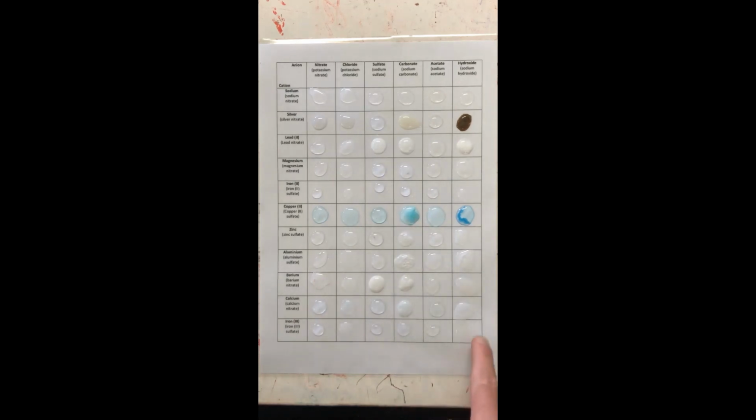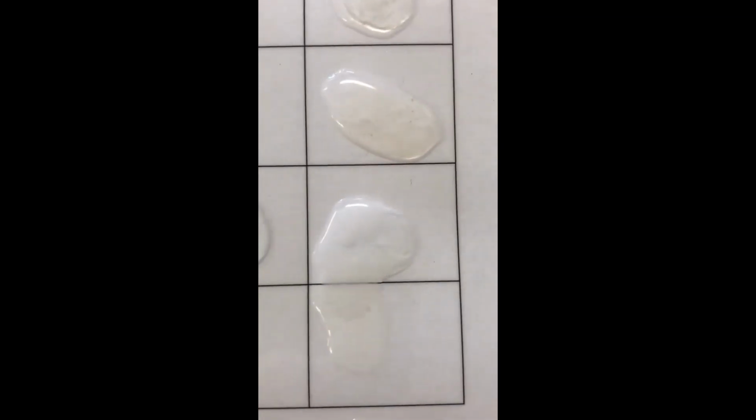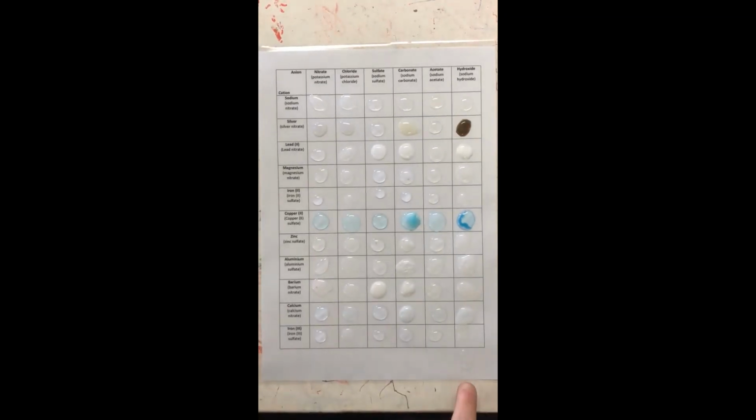Oh no, ours have mixed down the bottom. So I was going to do this one. Actually, no, we have also got calcium hydroxide has also produced a precipitate. All right, so we'll get a bit closer. Clearly you can see there and there, but unfortunately our solutions have mixed together, so I've now had to add a new one down the bottom.